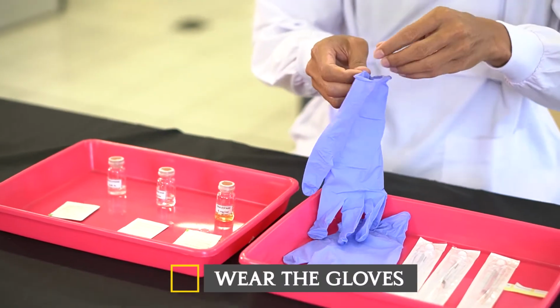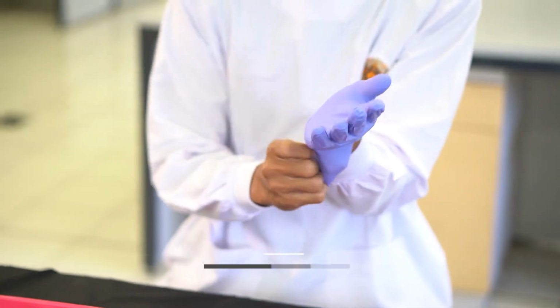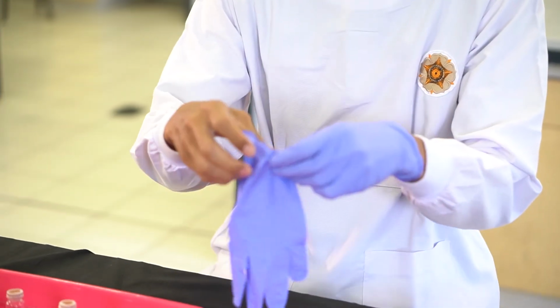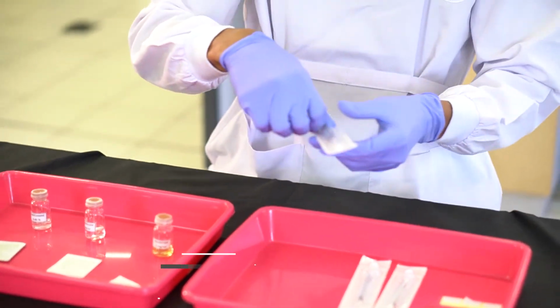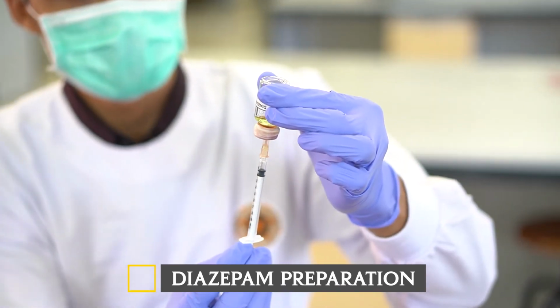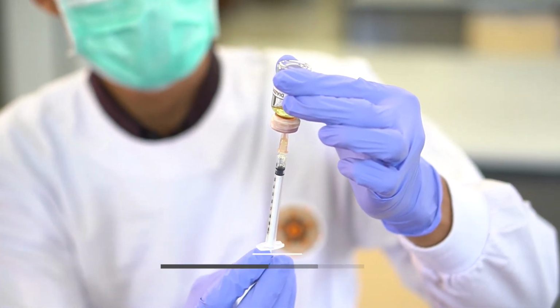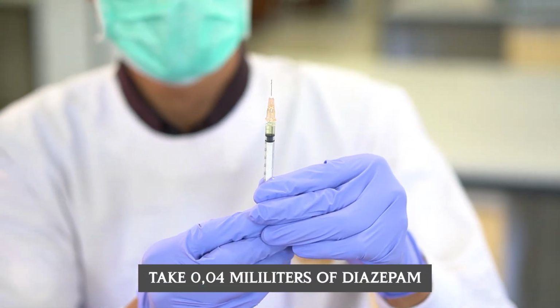Wear the gloves. Diazepam preparation: take 0.04 milliliters of diazepam.